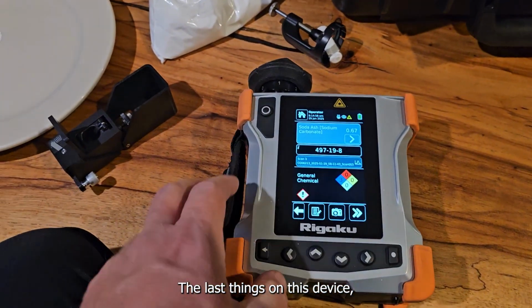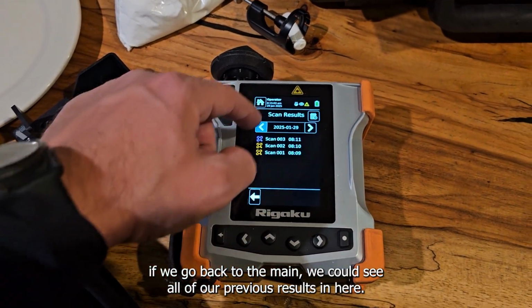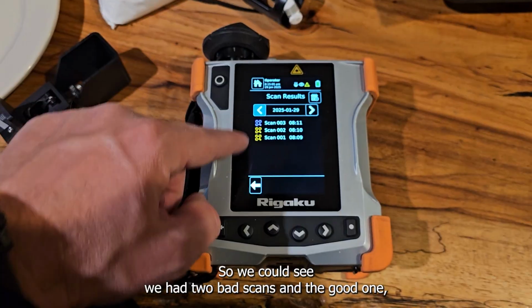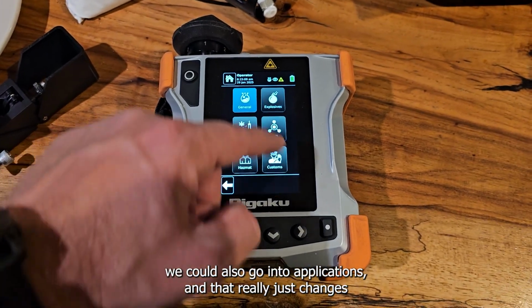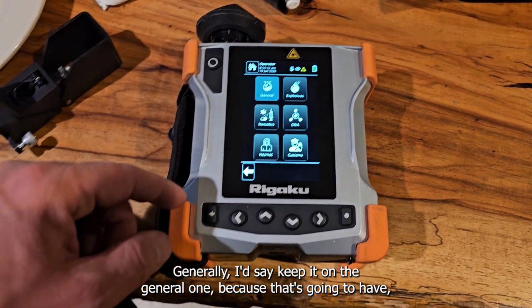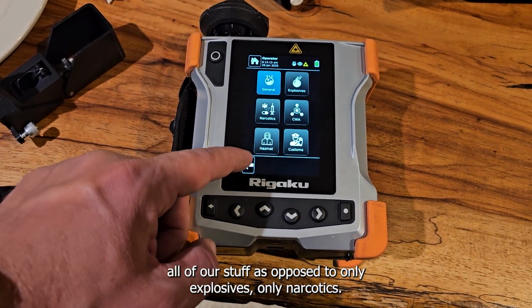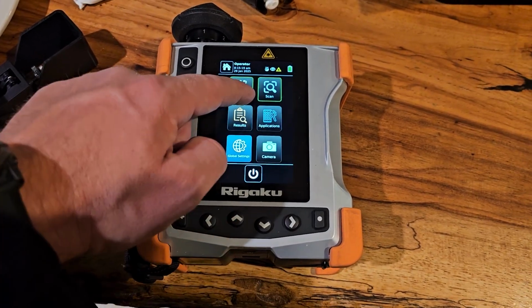The last things on this device, if we go back to the main, we could see all of our previous results in here. So we could see we had 2 bad scans and the good one. We could also go into applications, and that really just changes what the libraries are. Generally, I'd say keep it on the general one, because that's going to have all of our stuff, as opposed to only explosives, only narcotics.